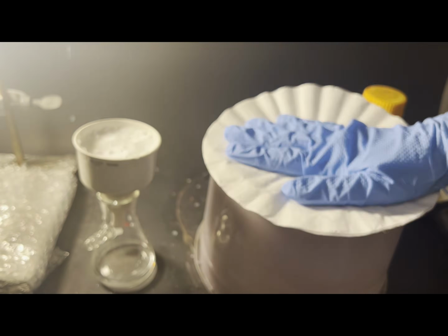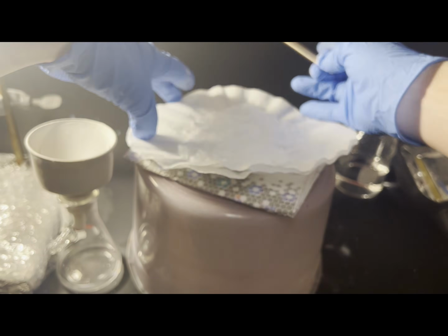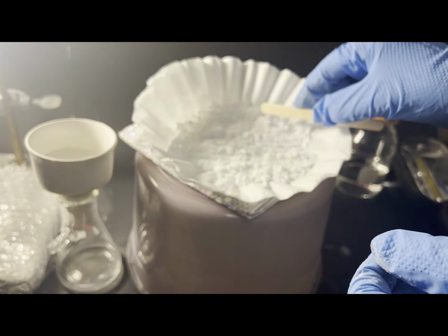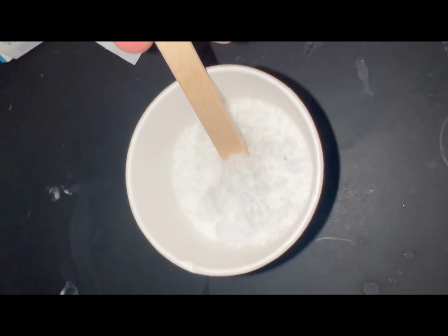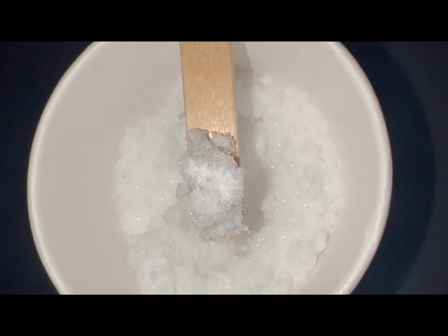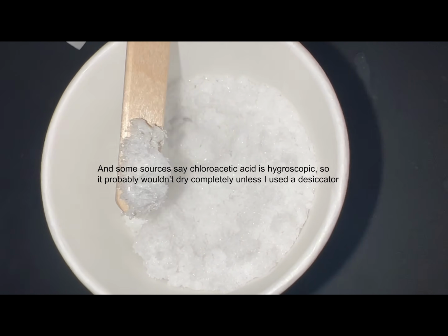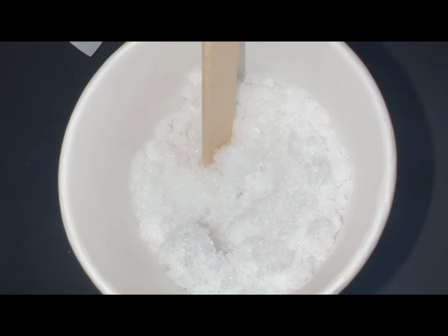As you can see, there was a considerable amount of liquid in the mixture. After running the filtration overnight, I transferred the filter cake to 2 coffee filters that had a few paper towels folded in half under them to wick off the remaining acetic acid adhering to the crystals. This worked fairly well. I could have done it again and gotten the last bit out, but I didn't. So here's what I ended up with.